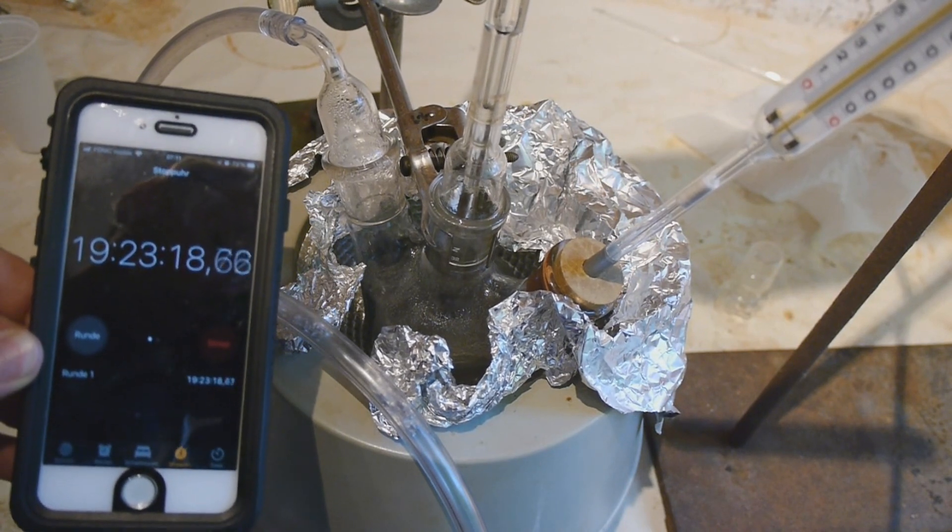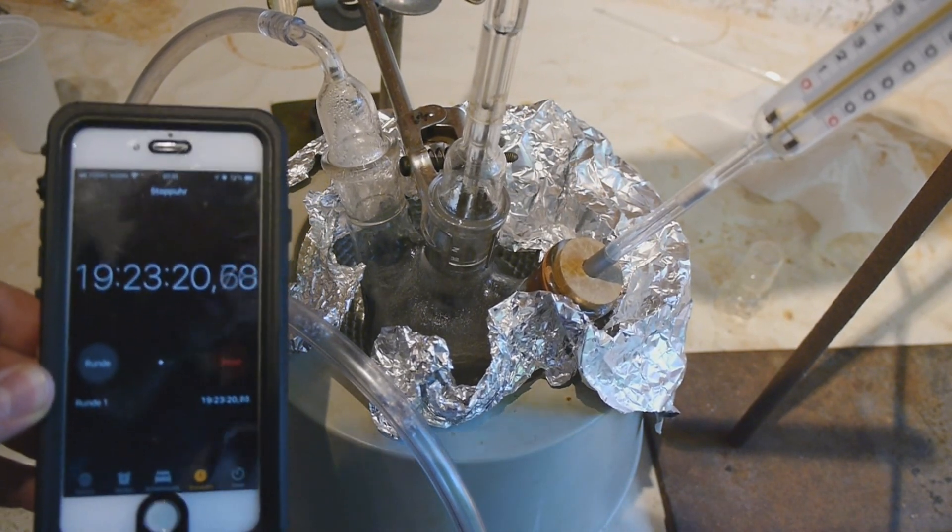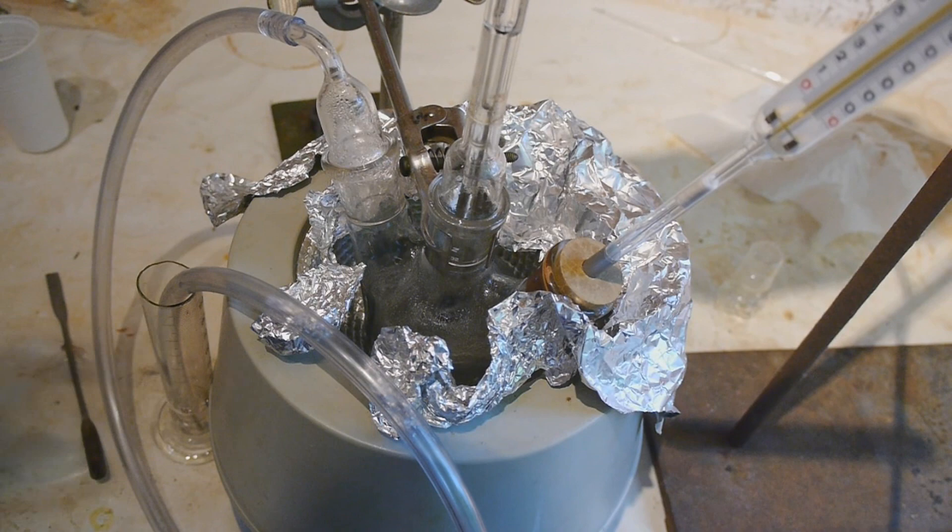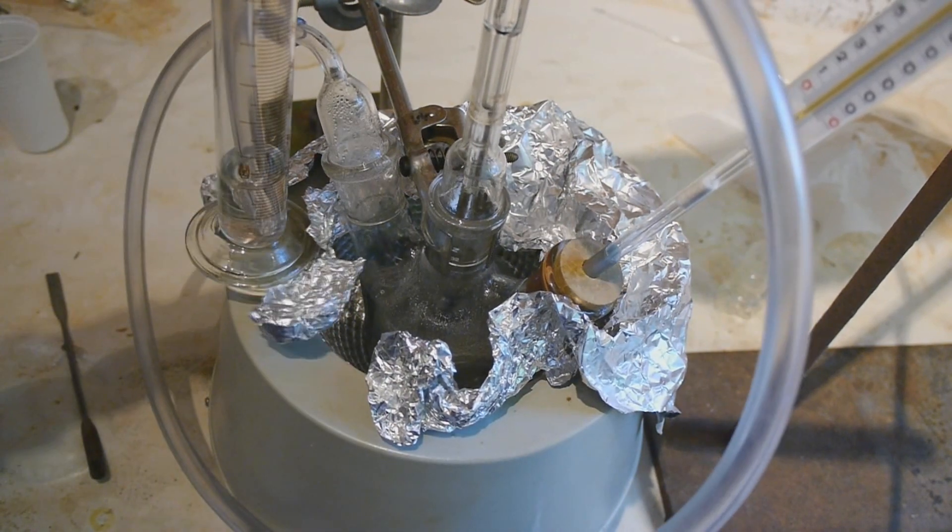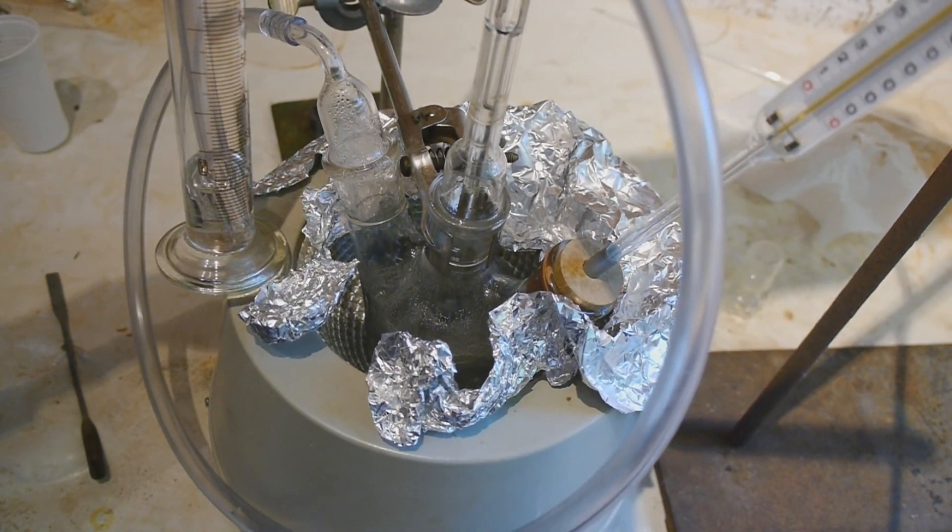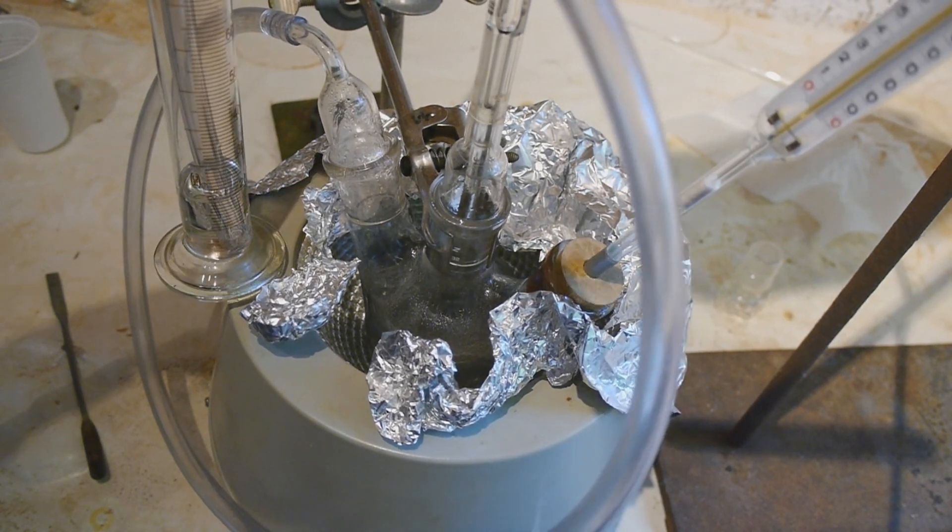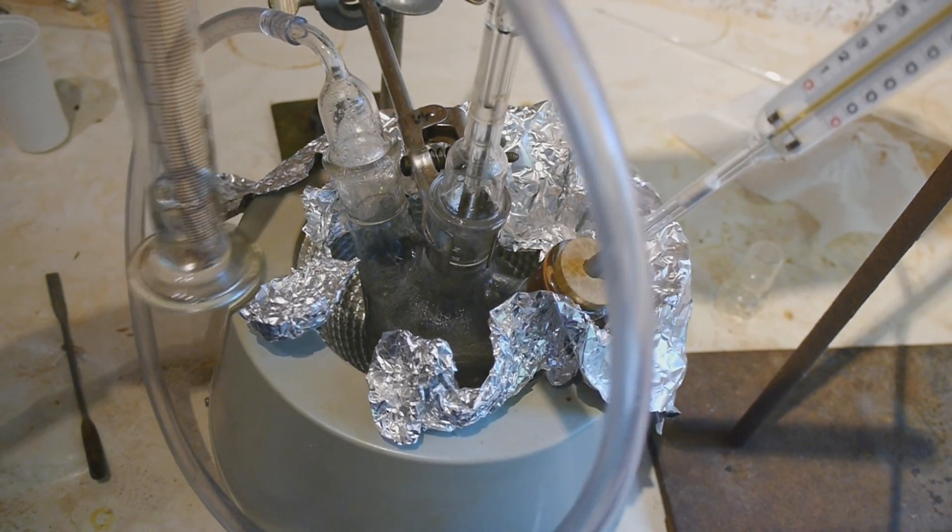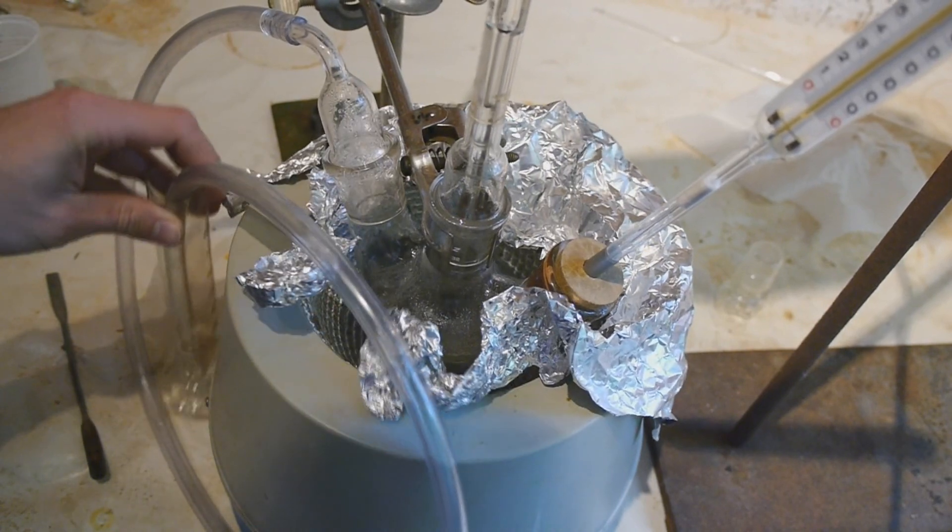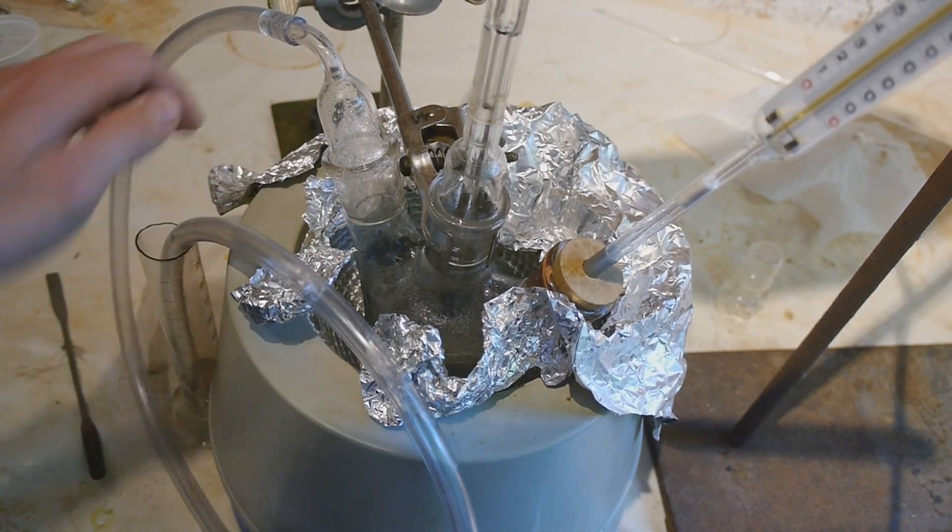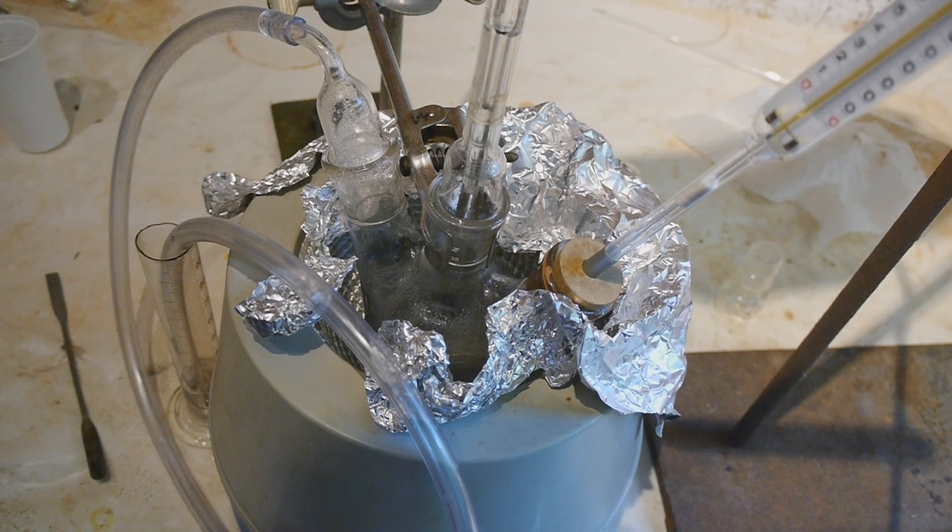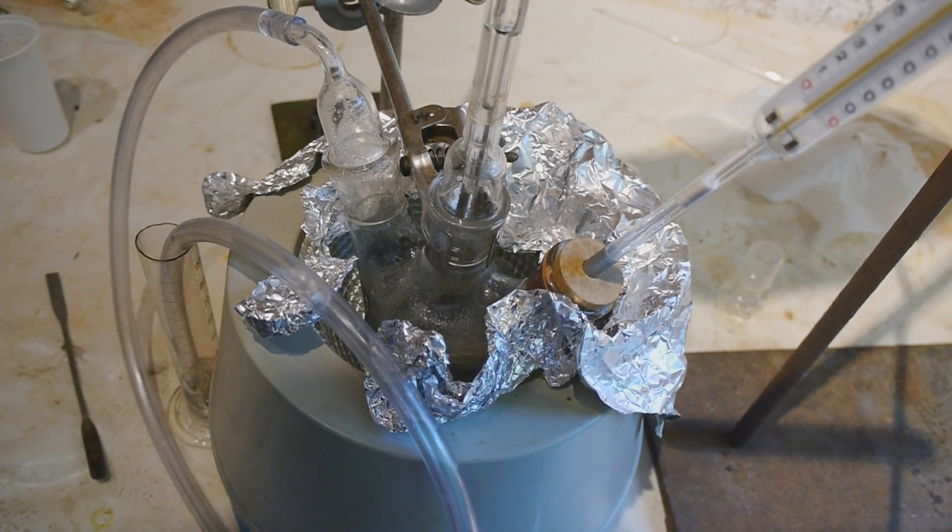So we are about 19 hours and 20 minutes into the synthesis. And as you can see the bubbler is going again but very slowly. Apparently the temperature was just too low earlier. It's really hard to set the temperature to exactly 200 degrees with this setup.